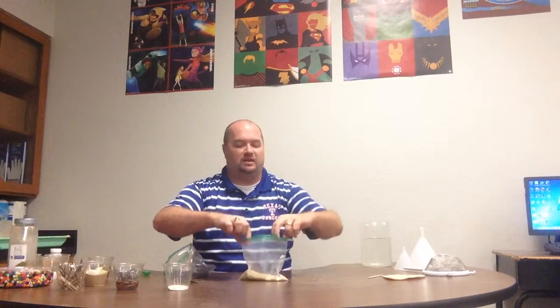Now, I told you I would tell you why I had the baggie. I'm fixing to show you. Here's a tip. If you're ever going to use a magnet with iron filings, don't ever put the magnet directly on the iron filings. The iron filings are teeny tiny. They're like teeny itty bitty pieces of dust made of iron. Once they stick to the magnet, it's incredibly hard to get them off. You end up having to peel them off with your fingers. They get all on your fingers. It's disgusting.